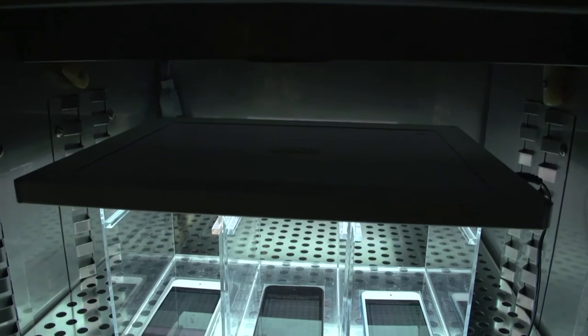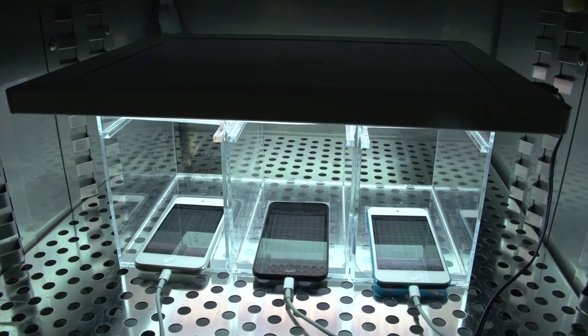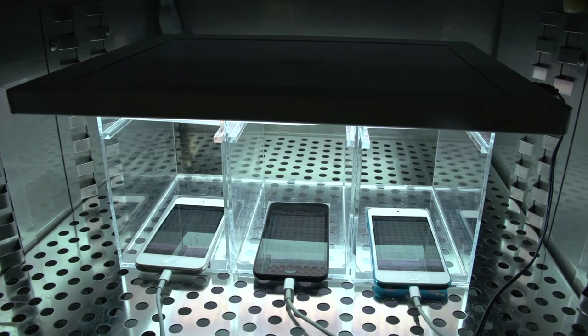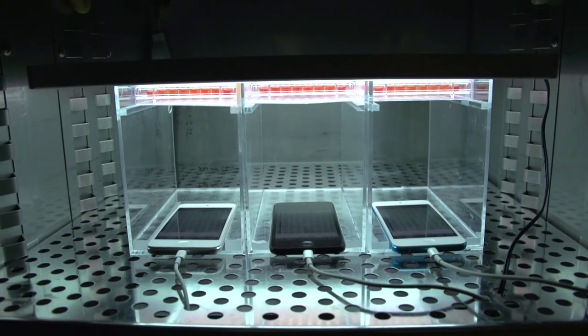It's cool because the iPod reduces the need to go under the microscope and image 96 wells. Now you can just set the iPod and go.